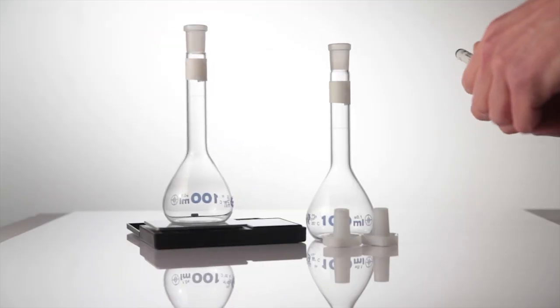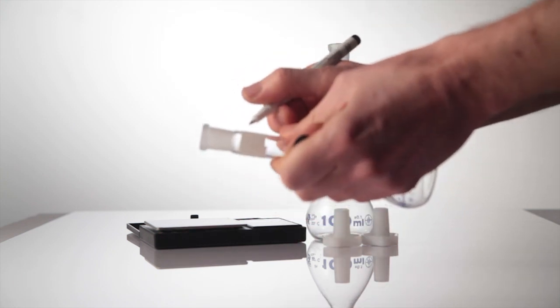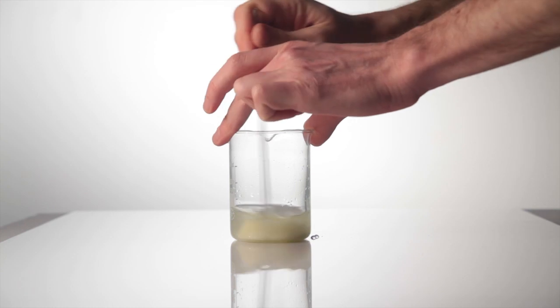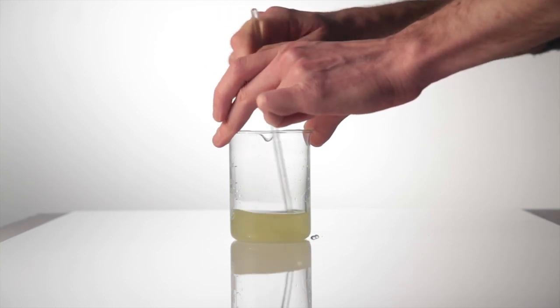I messed it up so that you don't have to. Begin by recording the empty mass of some 100cm cubed volumetric flasks. Then, dissolve each of the powders in about 75ml of deionized water in a beaker.